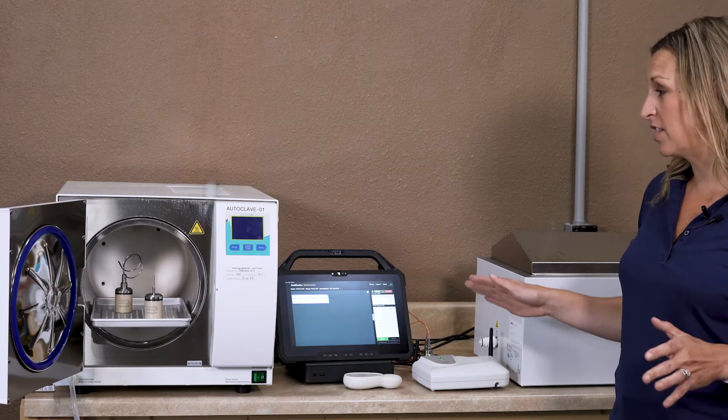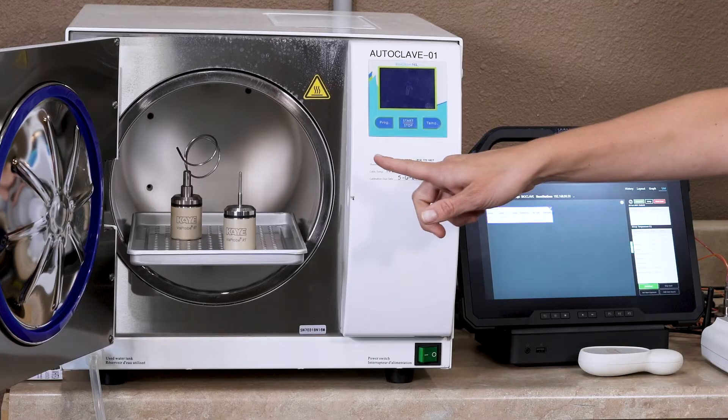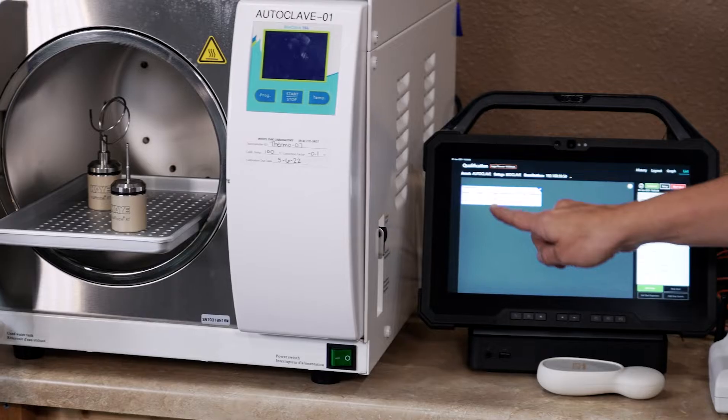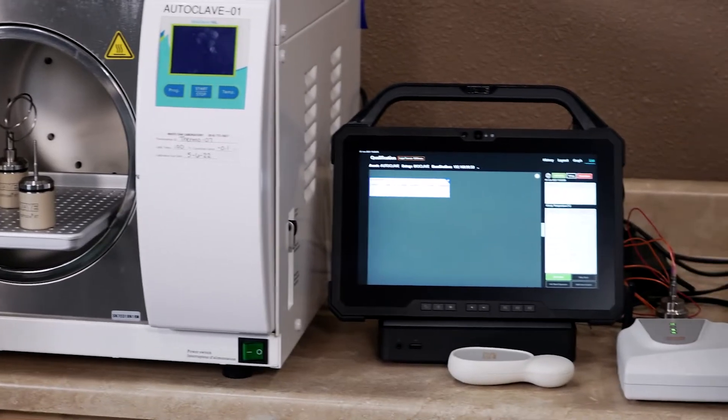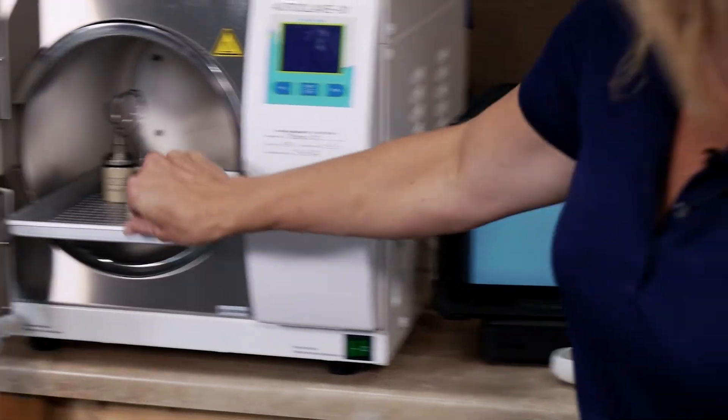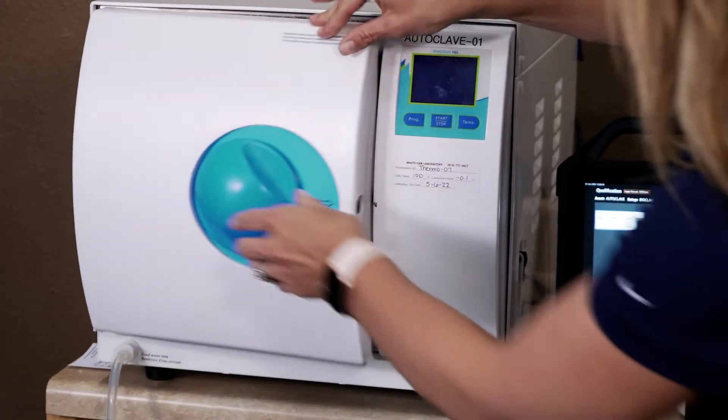It's very easy to start your study. You can see we have the two loggers in here and you're viewing your live data right here. Everyone likes wireless because you can simply just shut the door.